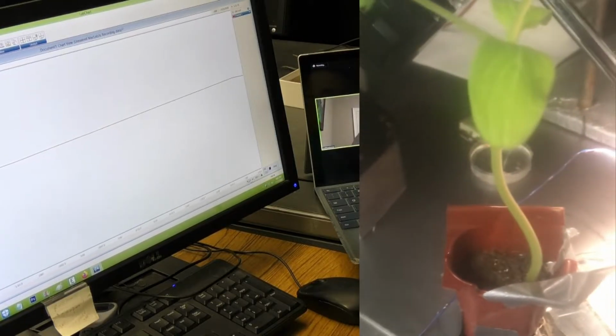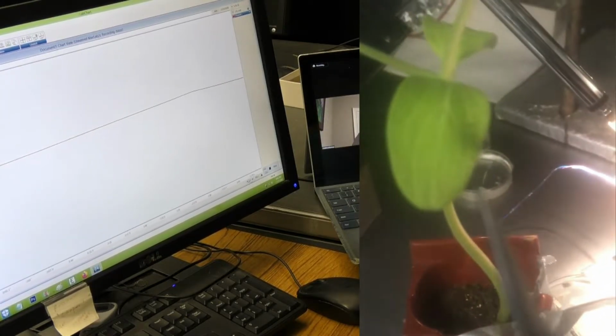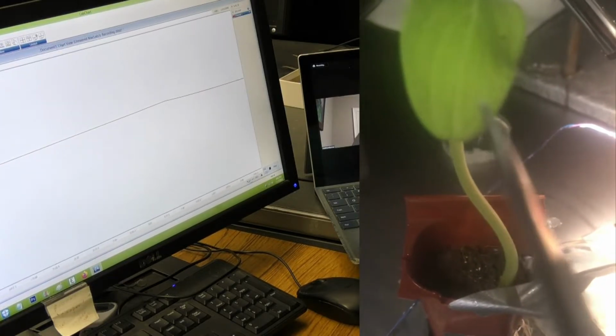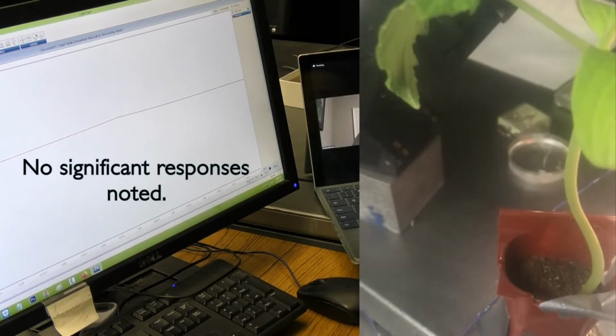There's touch the leaf. Well, it's not a fast artifact, it's just like before, but like the soil, but not as much. And it's probably because of things moving in the soil when I touch it. There we go. There's another touch.